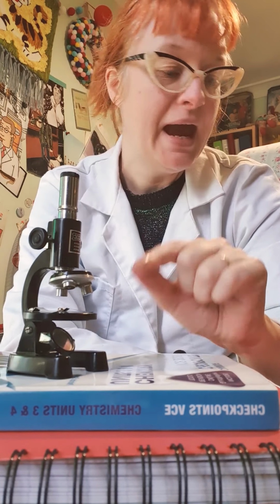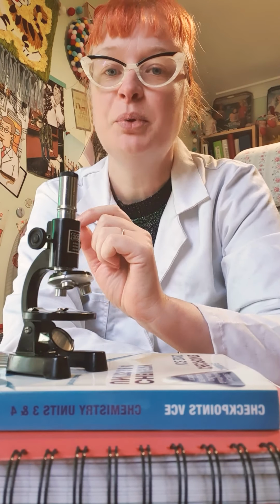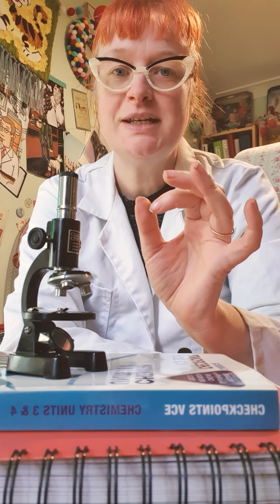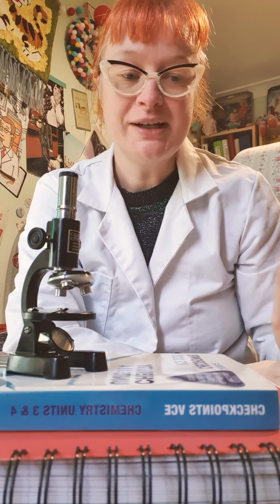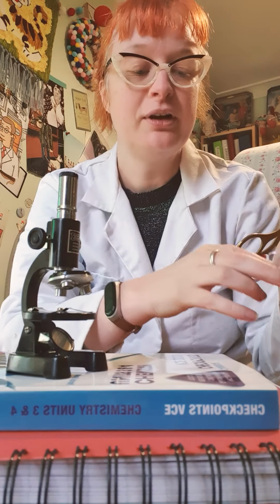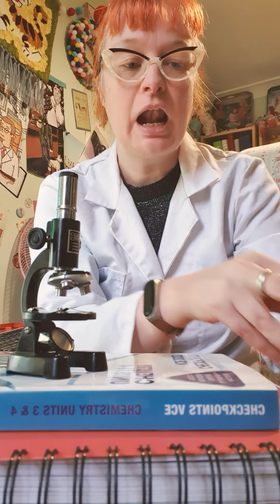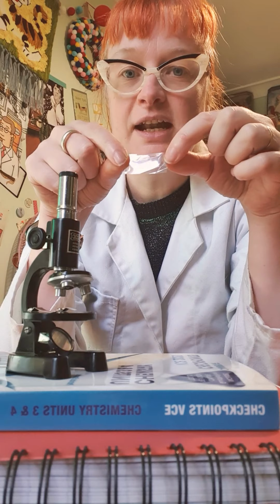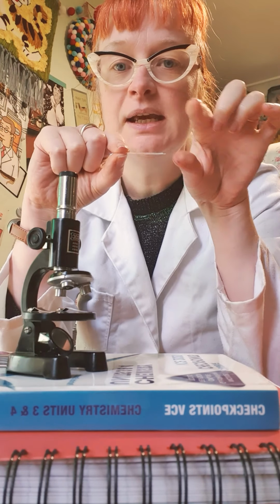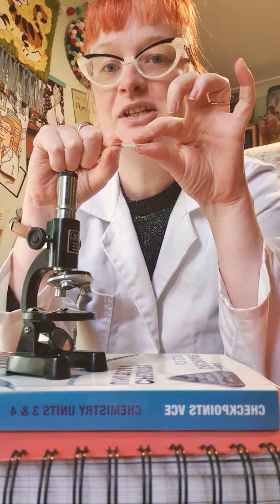So what we do when we have our full-size microscope is we prepare our sample. So this needs to be something small, quite thin and light. It can be alive or dead. And we put it on a slide. So a slide is just going to be, in our case, I'm going to use a model to show us. We would just have a little glass slide. It's just a tiny thing like this made of glass, and we can either put our little sample on it and leave it like that, or we put a little other piece of glass called a cover slip on the top, and it kind of sandwiches it in there.